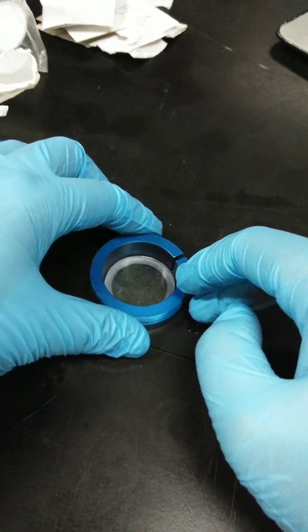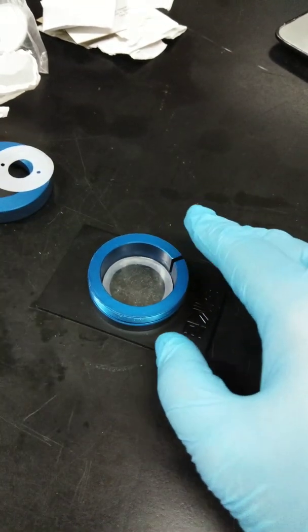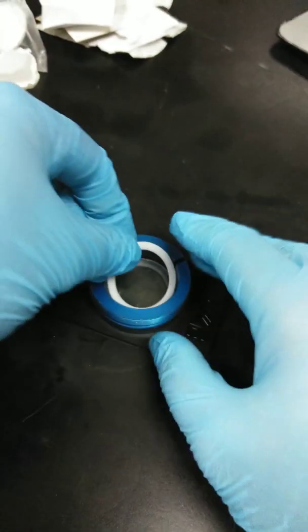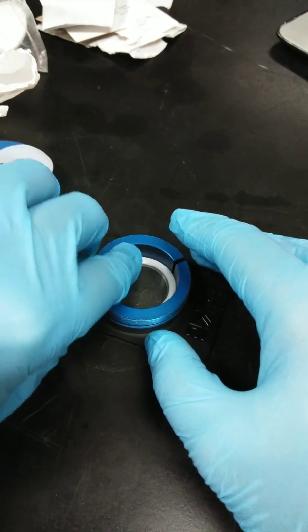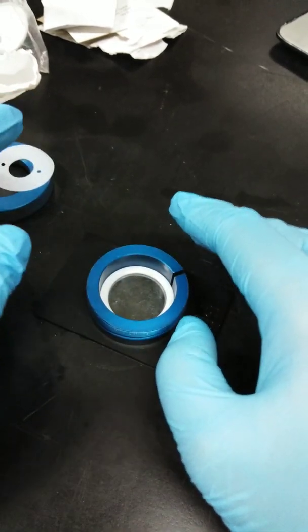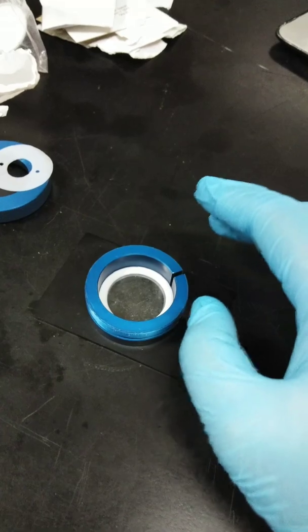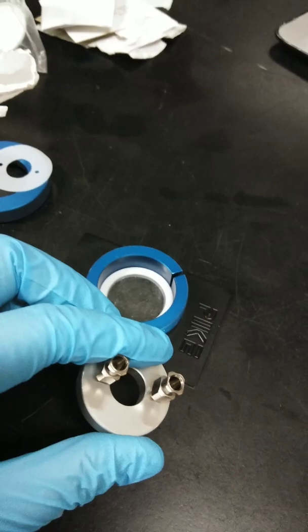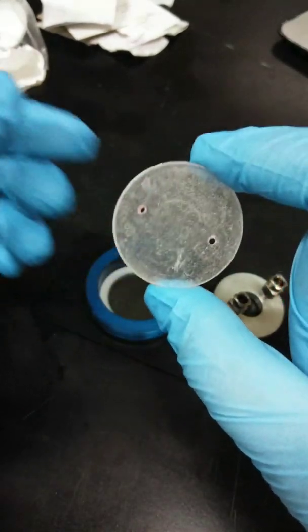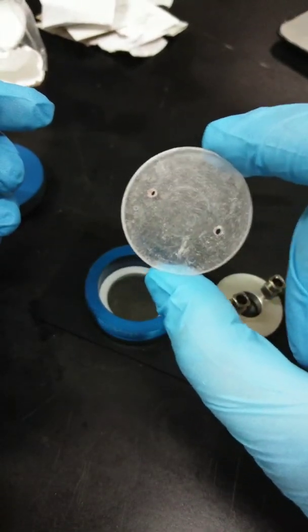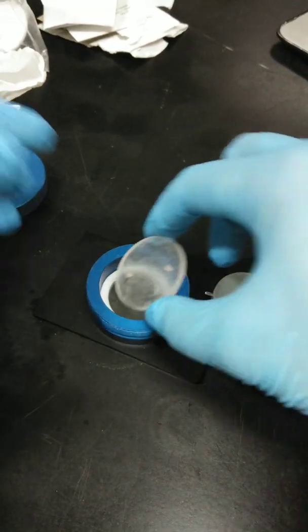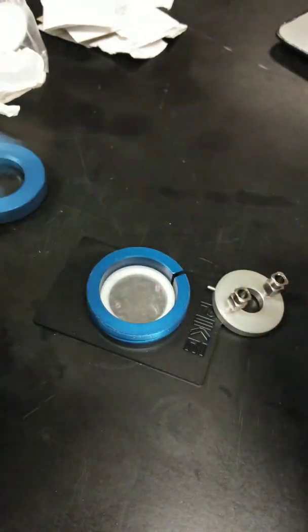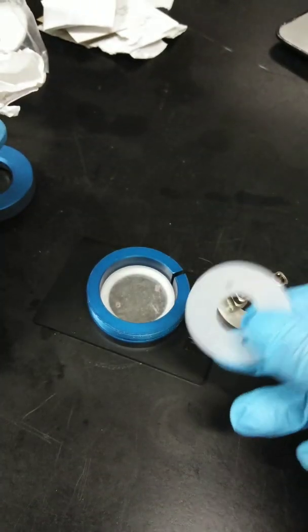And then, place the path length spacer. I said earlier the spacer. So we need a spacer, this one, on top of that plain plate. And then, we need to insert the cups or this part. Then, we need to position this second KBr plate, which is the drilled one, on top of this existing assembly. Now, the thing here is that we need to guide because we need to put this gasket on top of it.